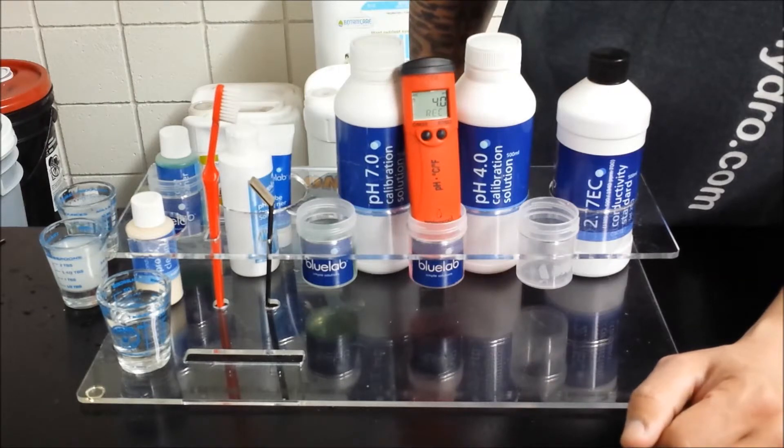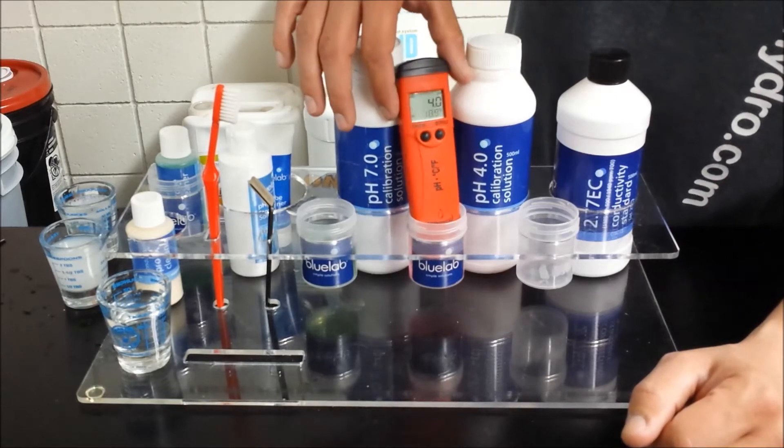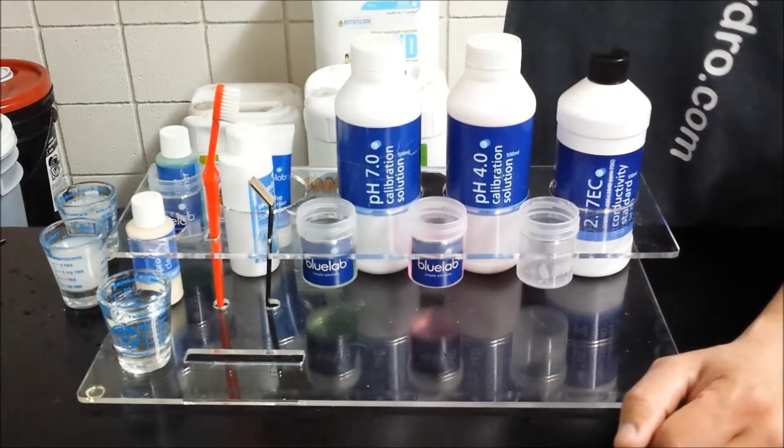Now you're just waiting for it to give you an OK. And then you're ready to go. There it is, all calibrated.